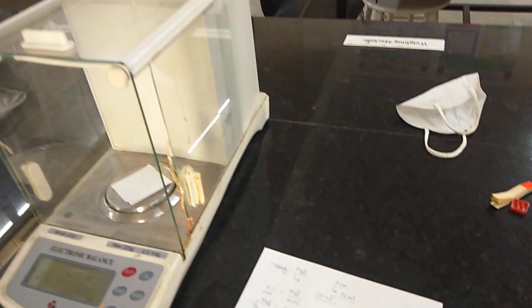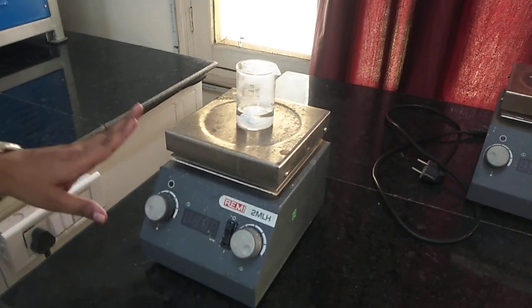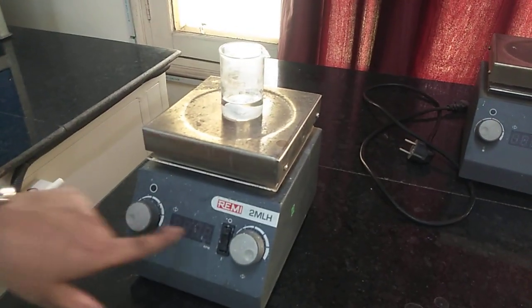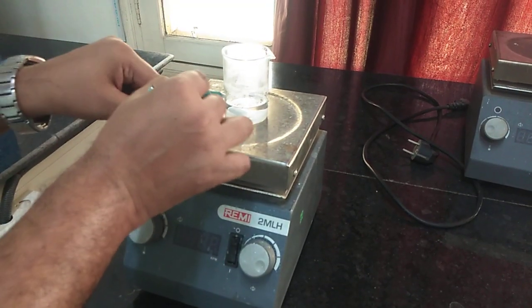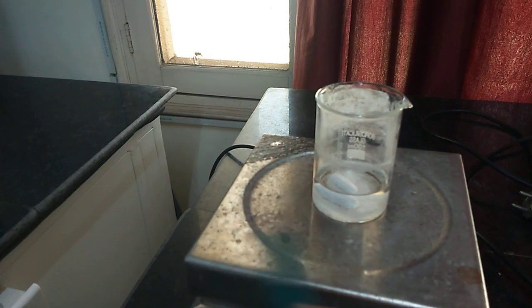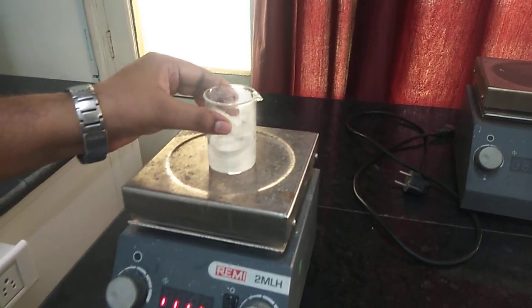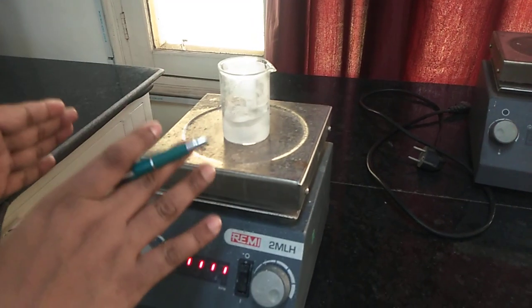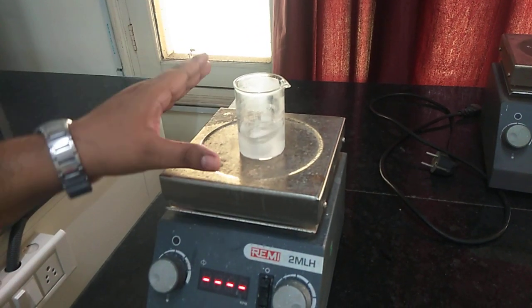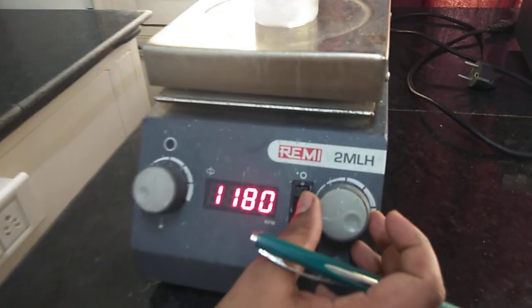I have taken 50 ml of solution and dissolved it using a magnetic stirrer. Here is the magnetic stirrer — one knob controls temperature, the other controls RPM. The white magnetic bead inside rotates when the stirrer is turned on. I have already prepared this solution for three hours, and the complete dissolution of zinc acetate is done.